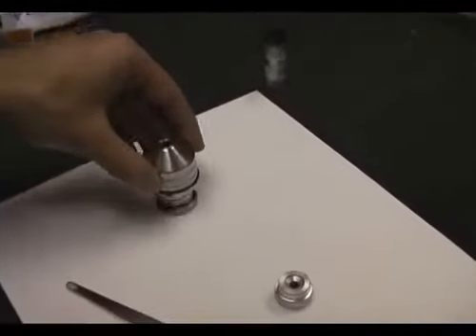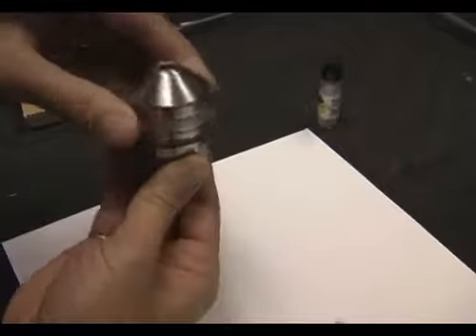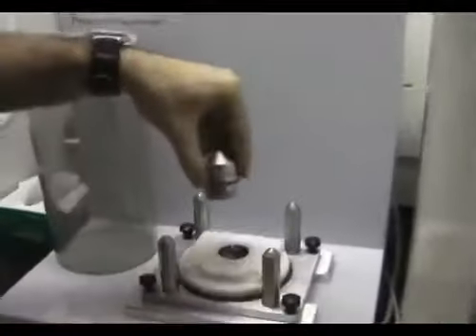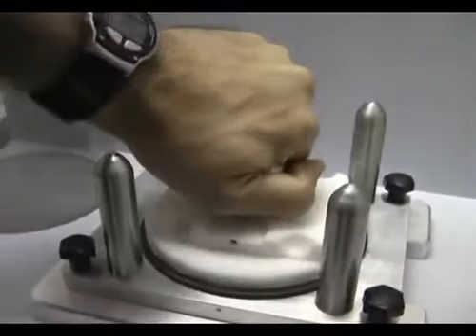Then you put the cover on top of the whole assembly and screw it together. Sample now gets placed on the main unit. So this chamber sits right here, and it's a bayonet fitting. You just have to rotate it to lock it in place.